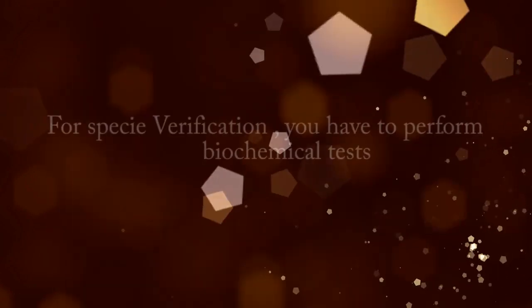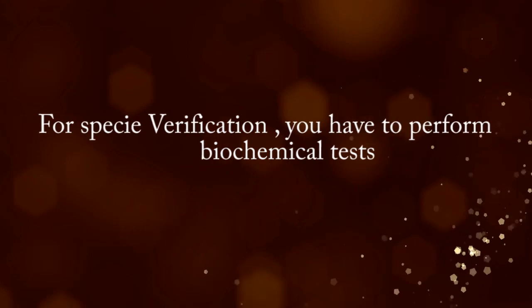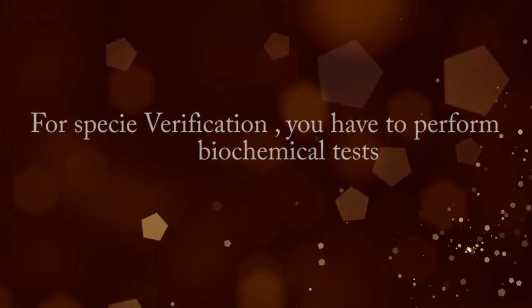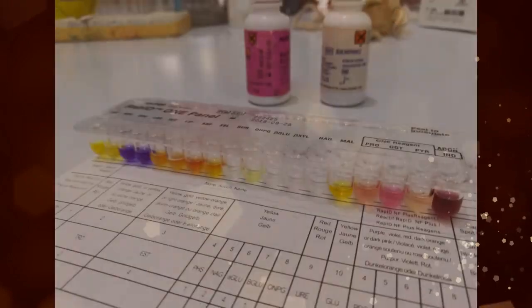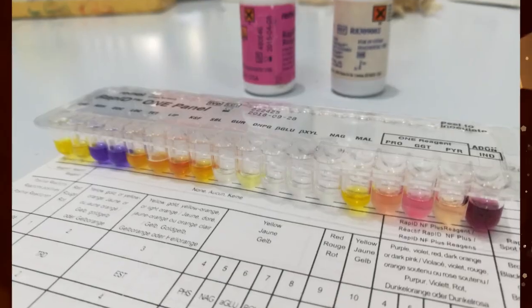For species verification, you have to perform biochemical tests, which are available as commercially available rapid test kits.